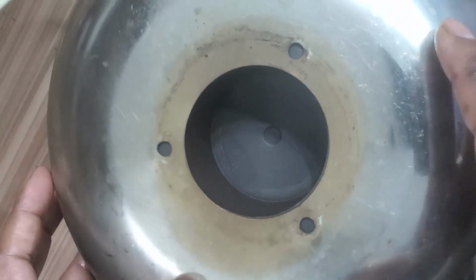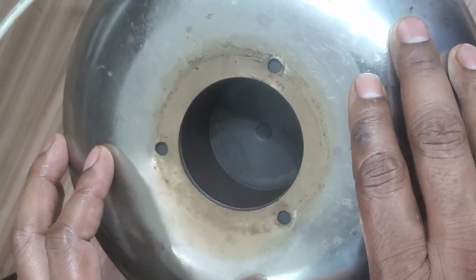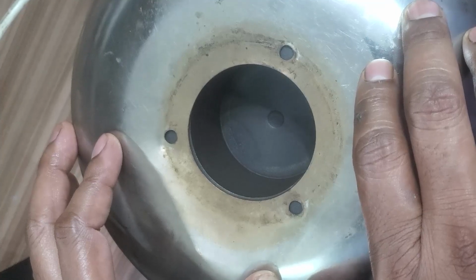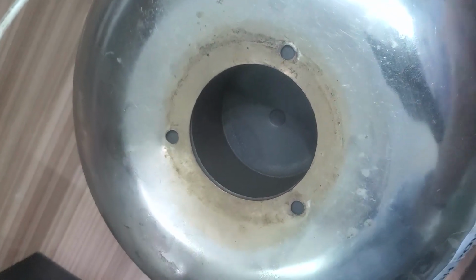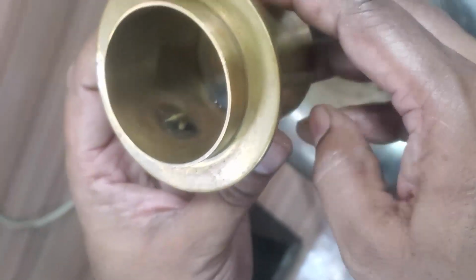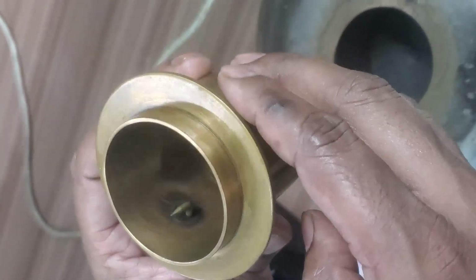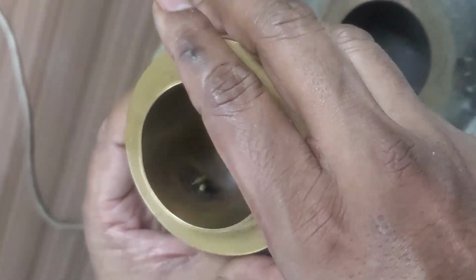It is a very simple thing. This setup is just a heater. This is the heater, because we want to heat the oil here. Diesel, if we want to heat, we need a heater. Just simply it is a heater setup. Here you can see the brass cup. Generally we will clean this brass cup with benzene or petrol. After that we will dry it. In this we are going to pour the sample, that is the diesel.